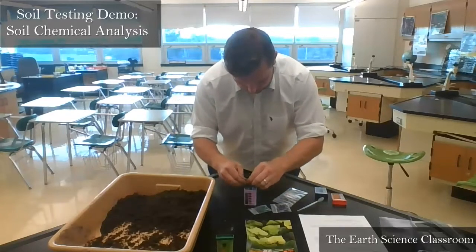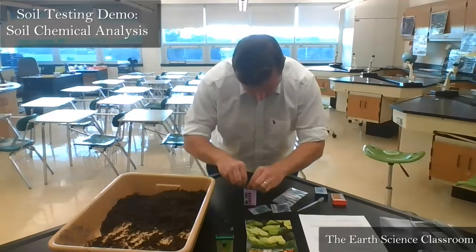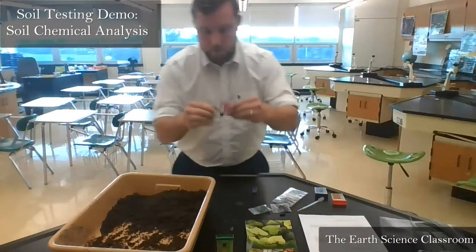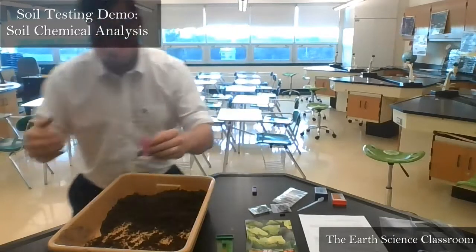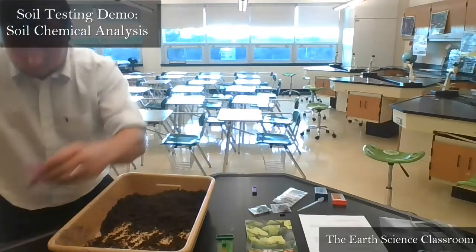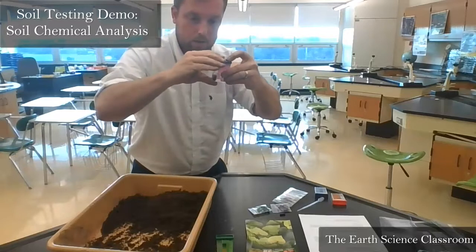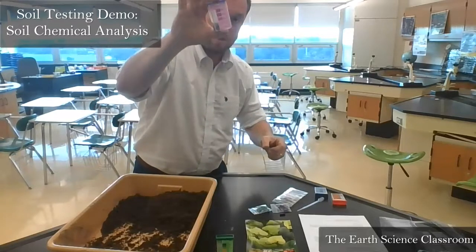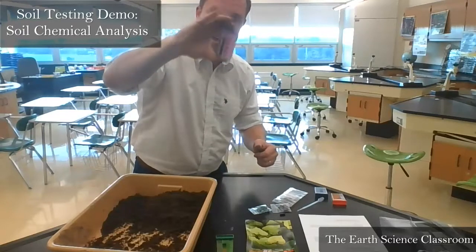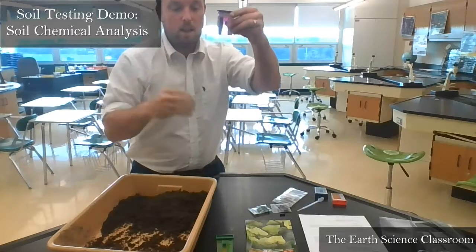We twist and release the chemical indicator. That'll give us our data, our reading. Okay, so we have our soil and our indicator. Then we add some water, like so. All right, and then we put back on the lid. Make sure it's nice and tight. Finger and thumb, and we shake to mix the water with the soil and the chemical indicator. About 15, 20 seconds. Let it settle.